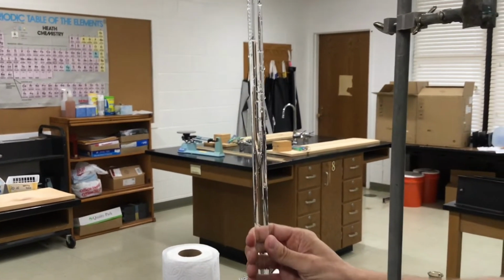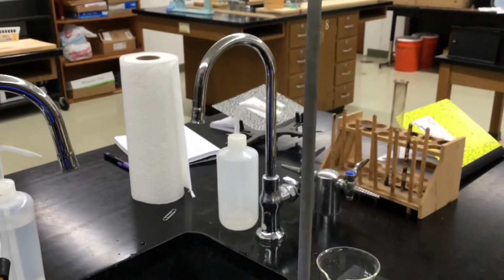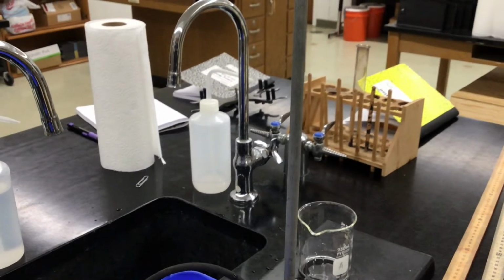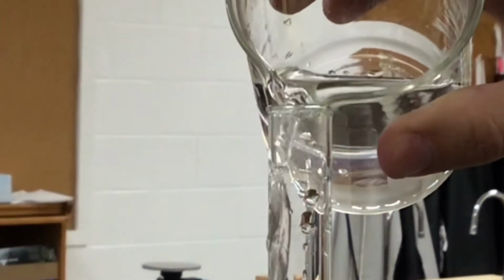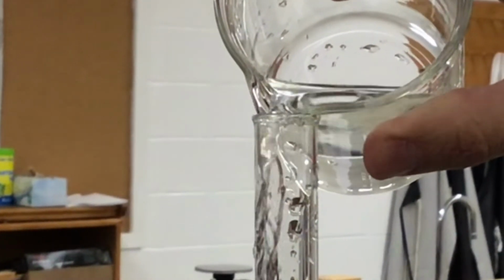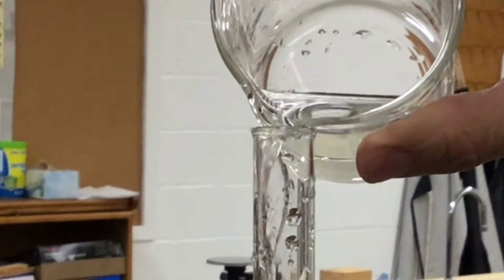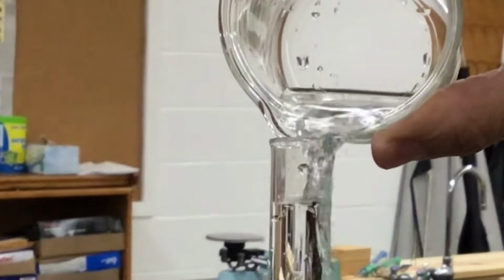Okay, I'm going to leave this over here out of the way. Video, see it? I think so. Okay, here we go. I'm going to pour water. What do you see about the edge? Little wavy lines. That's the gas leaving. It's the index of refraction of a gas. So I just let the butane go out.